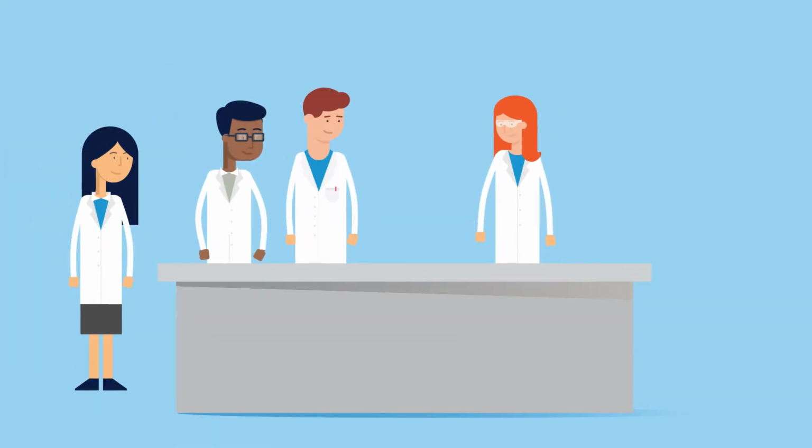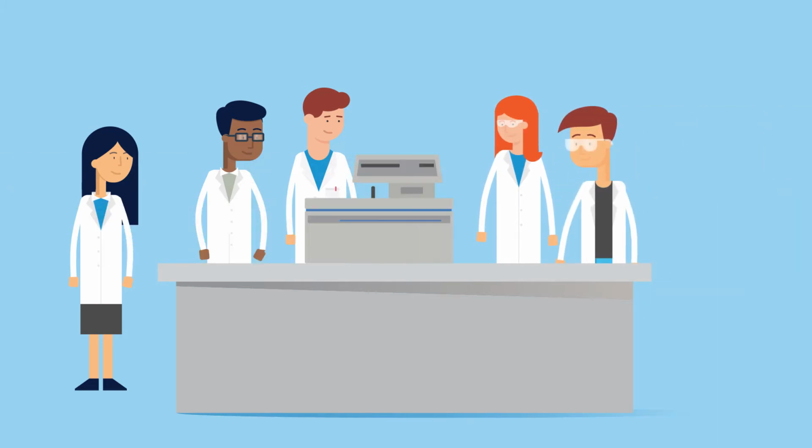Linda knows the value of protecting her investments, which means that she performs frequent care and maintenance of the equipment in her lab, including her lab's centrifuge and rotors. She also knows that all laboratory equipment needs to be replaced at some point. Today, Linda and her staff are evaluating their centrifuge and rotors for signs that they may need replacement.